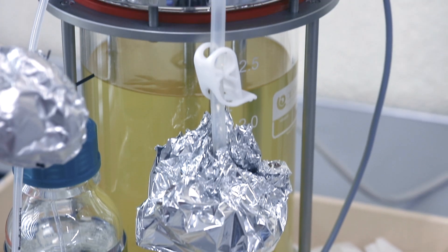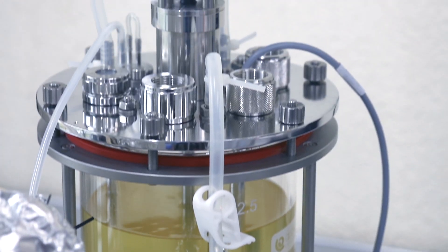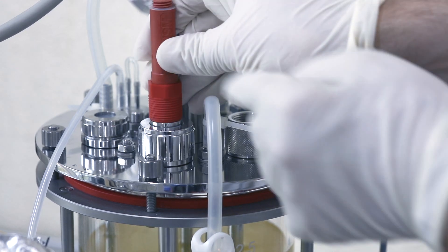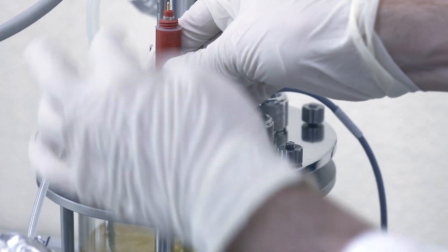The sensor is now ready for mounting in the bioreactor. Once the bioreactor has been fully prepared, it must be autoclaved.